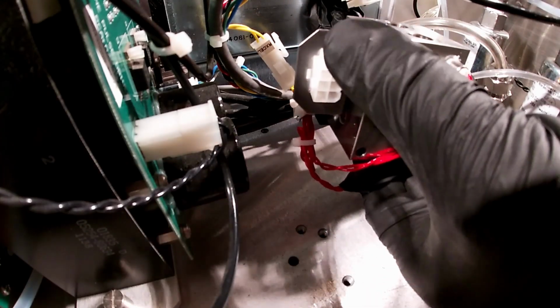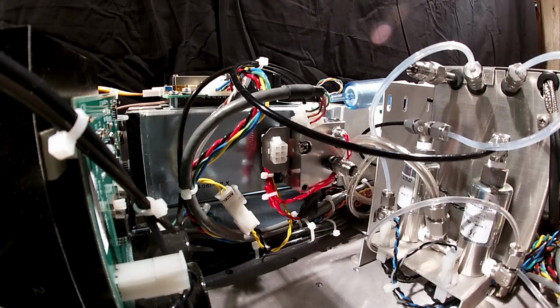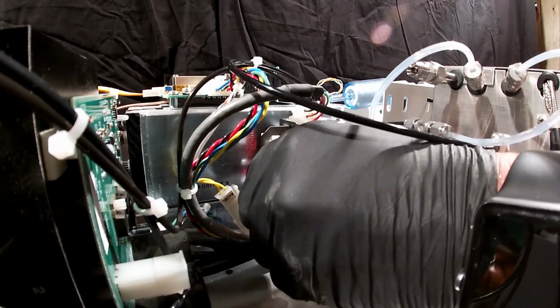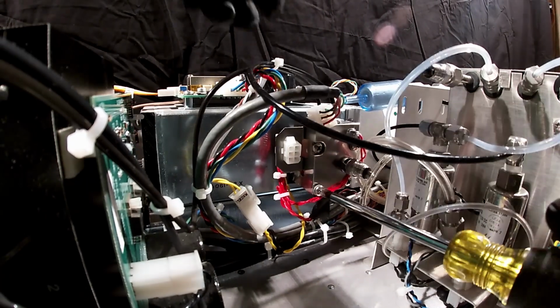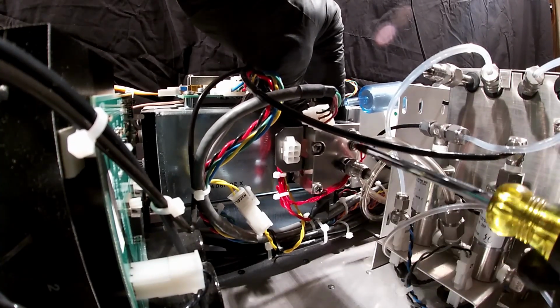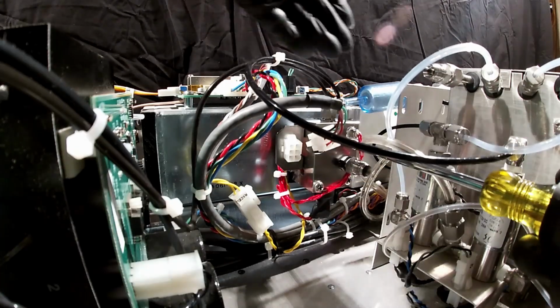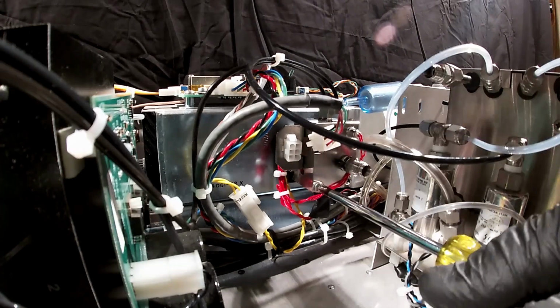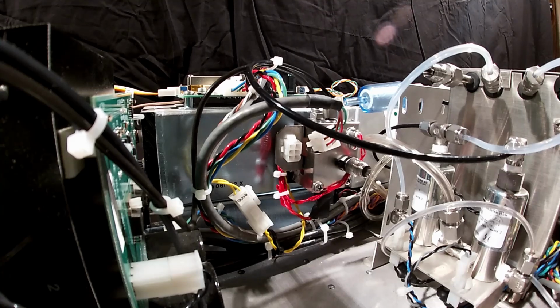So we've got our reaction chamber back on here. I'm going to slide this glove out and feed this back into the PMT cooler. Okay, we're putting our reaction chamber back on here with our two longer screws. Feel them make contact if you sort of rotate that a little bit. So get them both down before we tighten them all the way, just to make sure that we've got a nice flat fit there, and that will tell us that our O-rings are all sealed up everywhere. So remember, just hand tight, no excessive force needed.